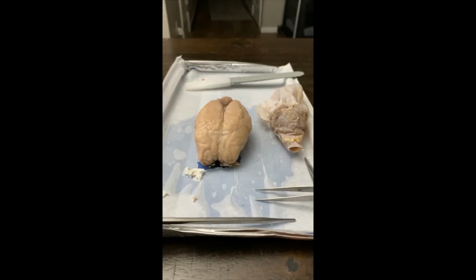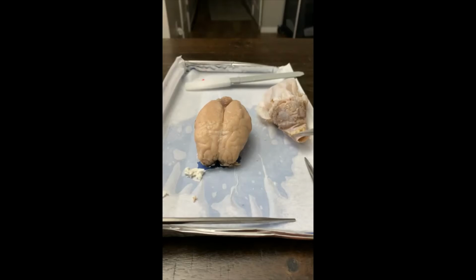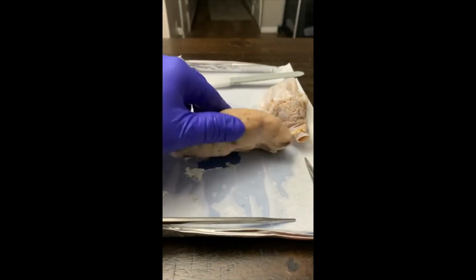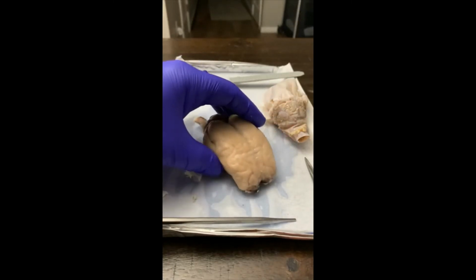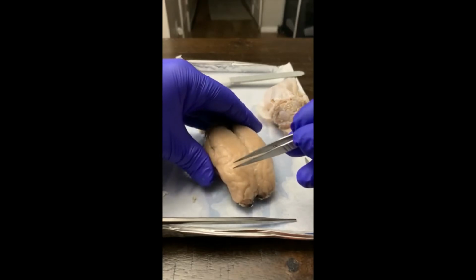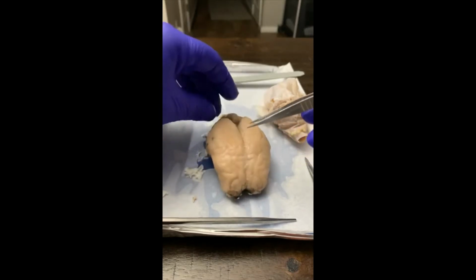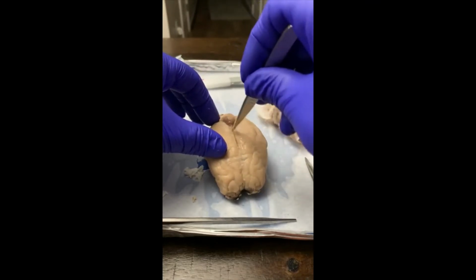Okay, so now that we dissected off the meninges here, we'll go into some of the exterior aspects of the brain. At first we're going to start with the cerebrum, which is going to be the largest portion of the brain here. Right here, these ridges, these kind of thick areas here, those are going to be the gyrus. And then those lines in between, those little valleys, you can think of like a ridge and a valley, those little valleys are going to be the sulcus. And then the longitudinal cerebral fissure is going to be this long valley down the center.